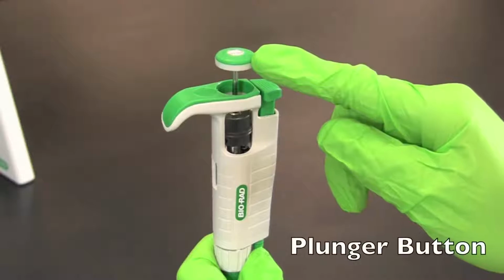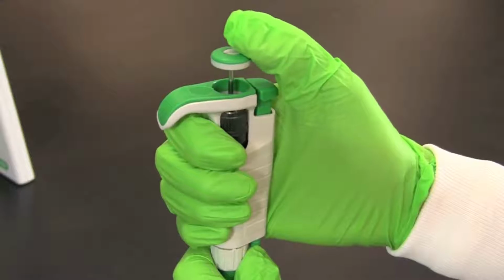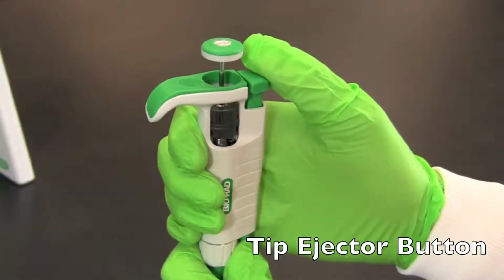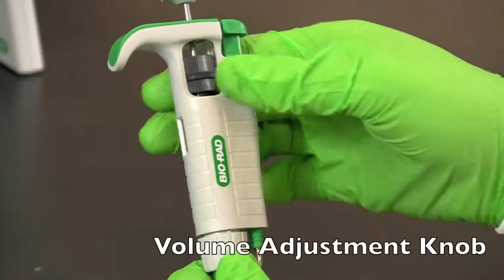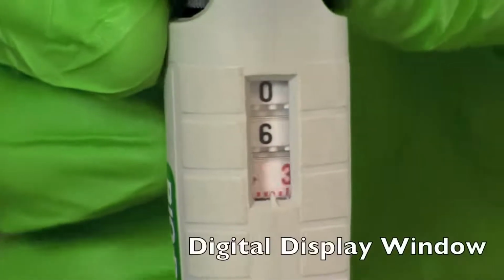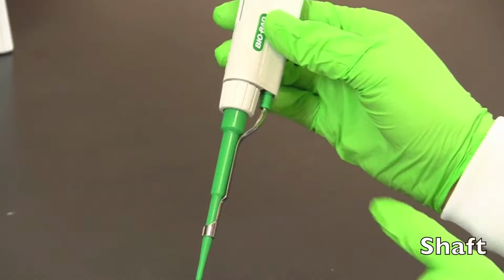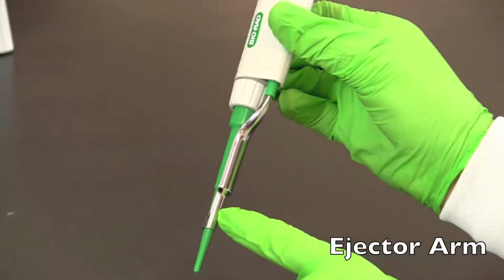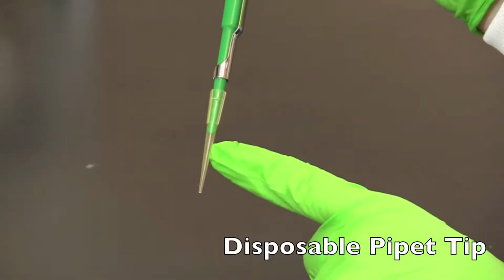The parts of a micropipette include the plunger button used to fill and dispense samples, the tip ejector button used to remove used tips, the volume adjustment knob used to adjust the volume you wish to transfer, the digital display window displays the volume being selected, the shaft, and the ejector arm, which ejects used tips, and a disposable pipette tip.